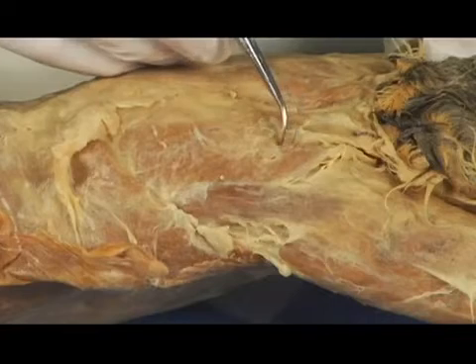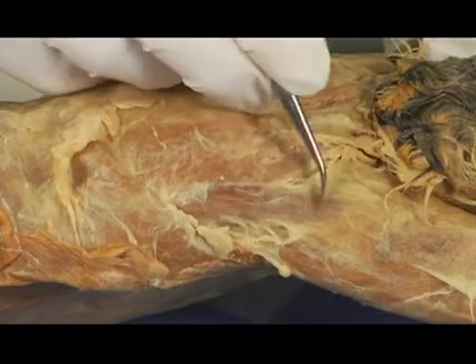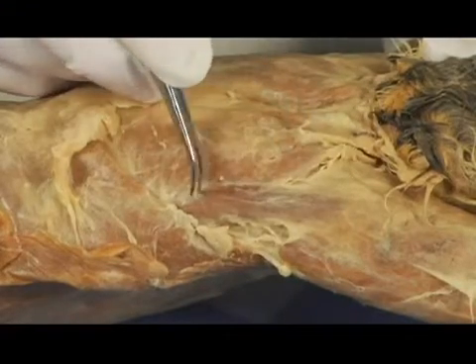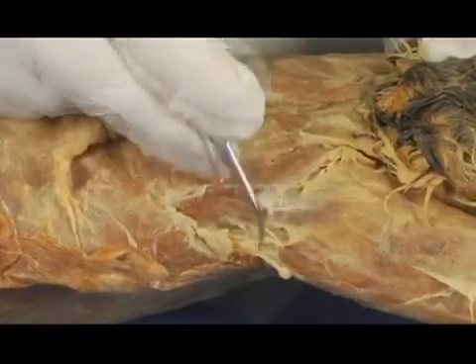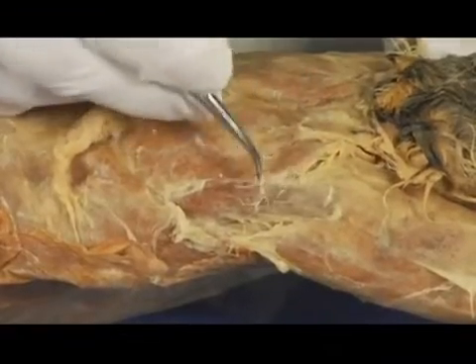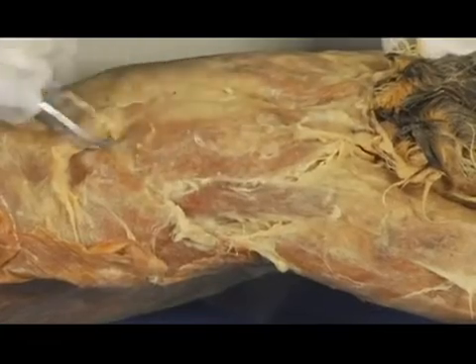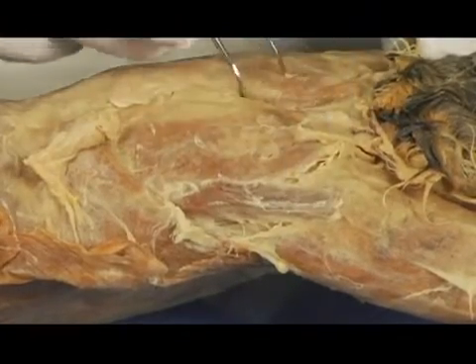And this muscle, so there is the levator scapulae ventralis, and right below that is the spinodeltoid. And I think you can see that pretty well. It sits there, it goes at an angle. So again, this is something where if you want to remove a little bit more fascia, you can. And I'm going to try to define the muscle just a little bit more by doing that. Okay, so there it is, right along that line there, and that's great.